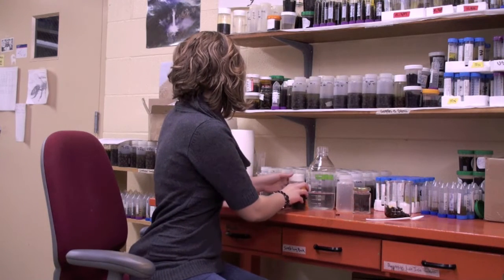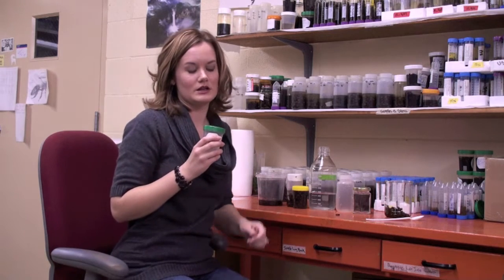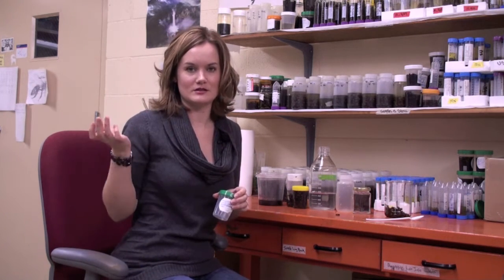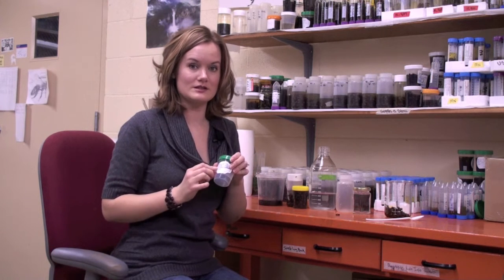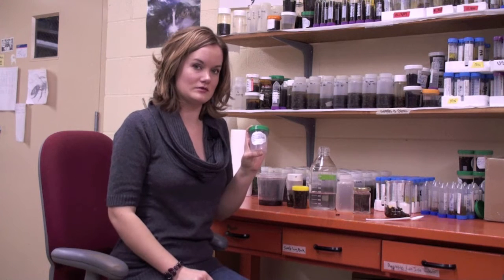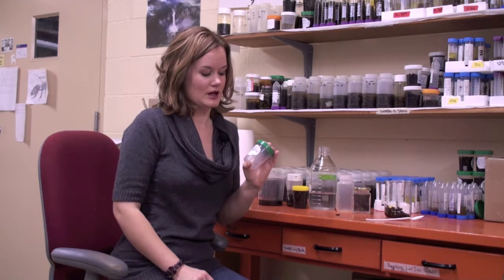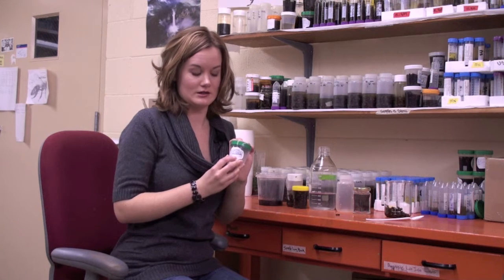And the next step, you can also use a urine sample bottle. And these are actually really good. You can get them for 50 cents at your local pharmacy, but they usually have this tape sticker on the outside. And what you can do is write the date that you sampled on it. So again, not the date that you're sending it to me, but the date it was actually sampled, and then the colony number, and then your name on the side of it.